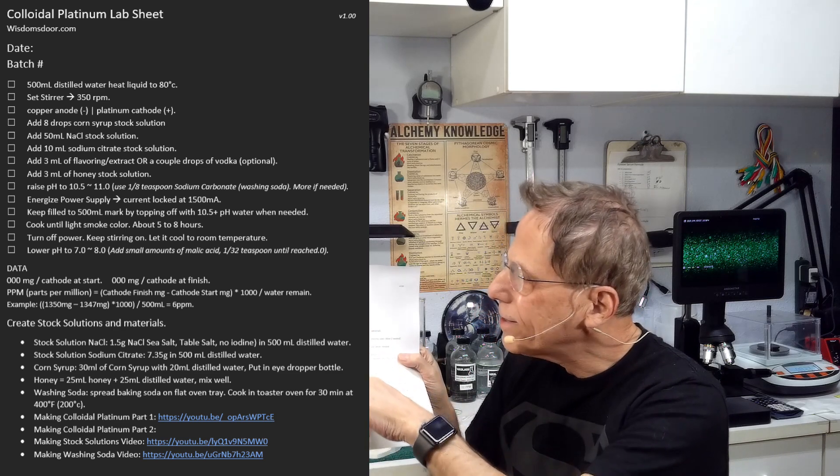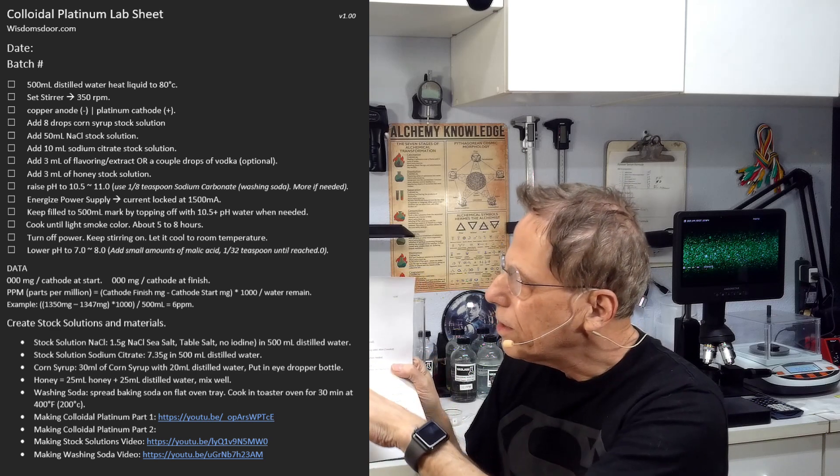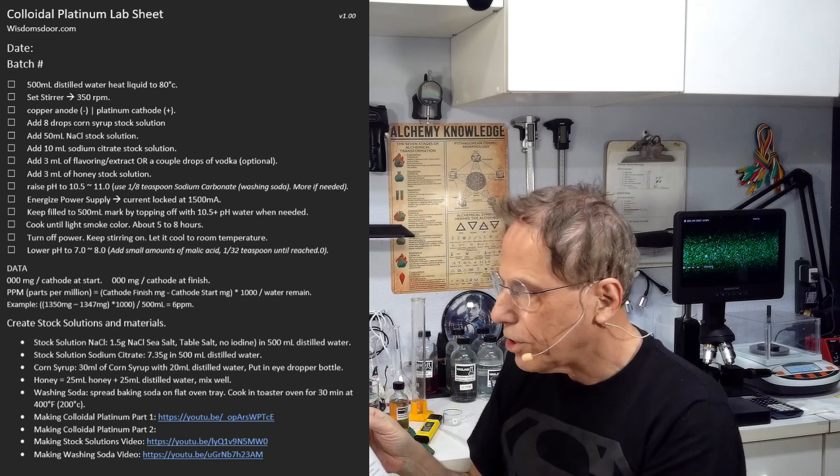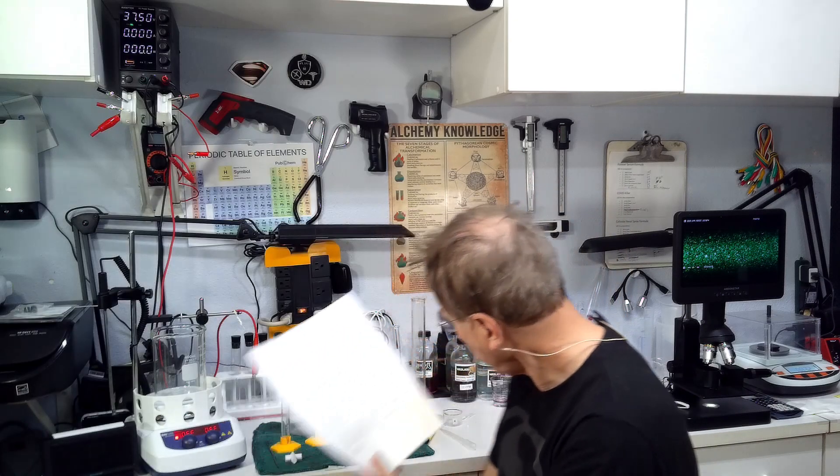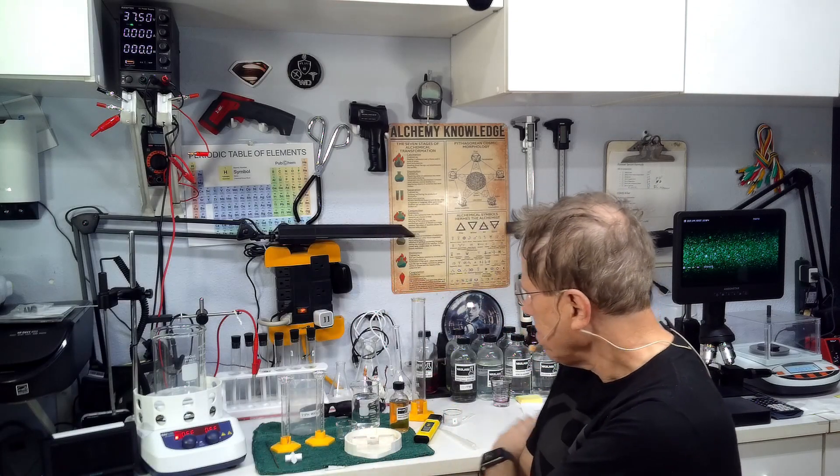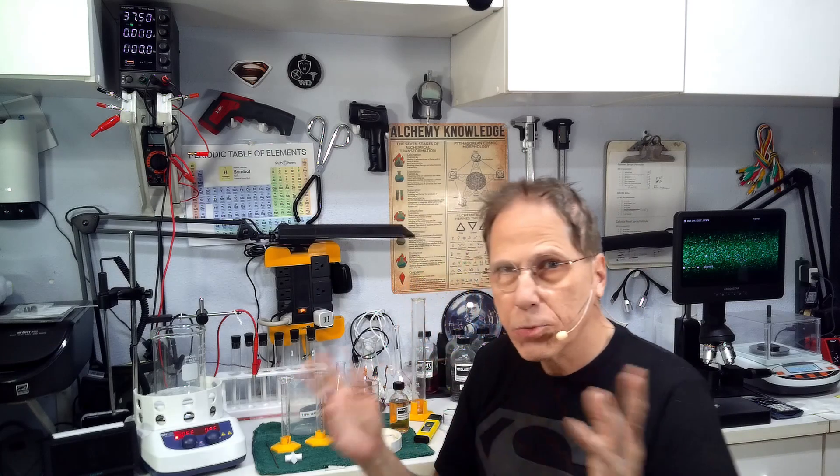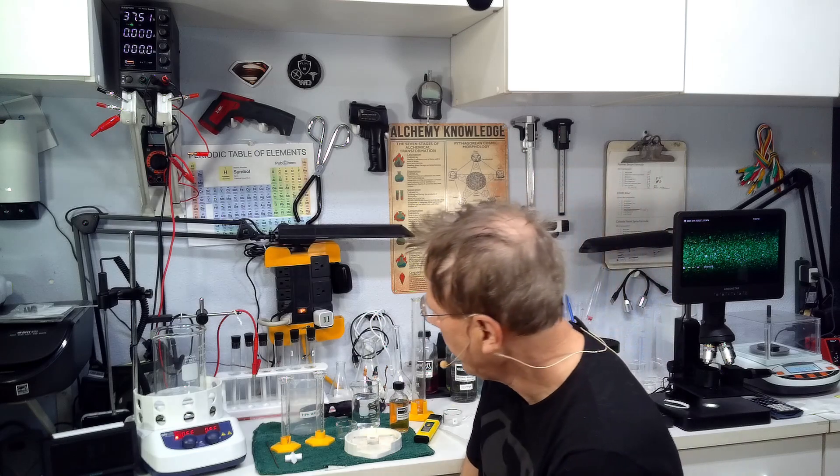Basically you're going to check off all the boxes as you go down. It tells you everything that you need to do in order. If you want explanations and why we're doing certain things, you need to watch the other videos.